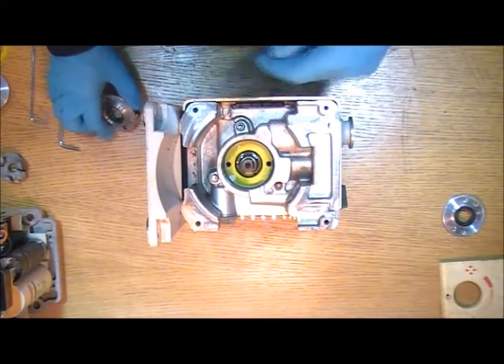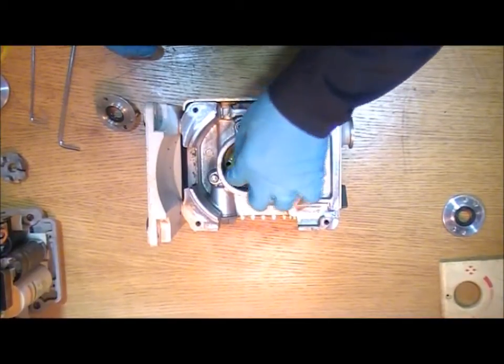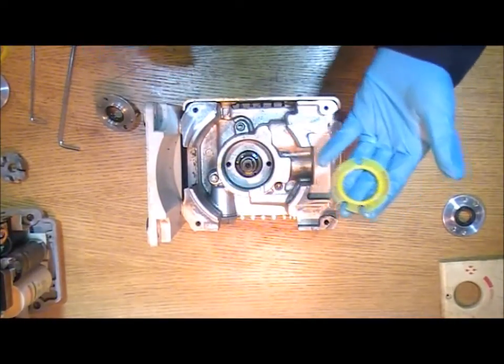And then underneath you can see the old gasket which again we're going to replace. So lift that out.